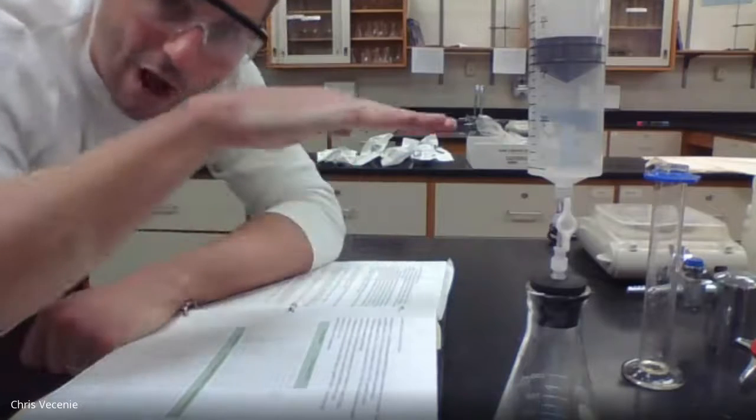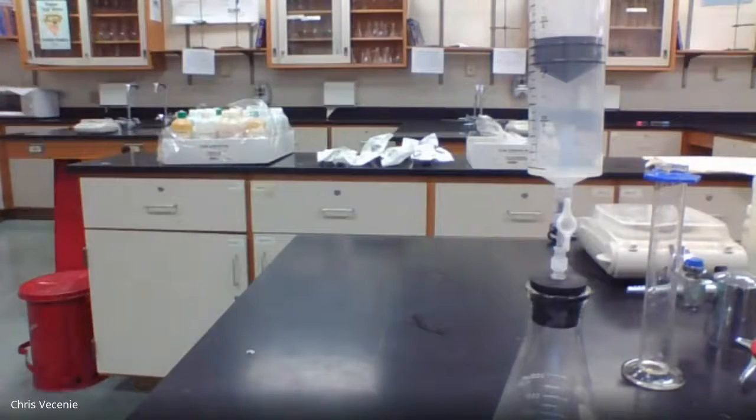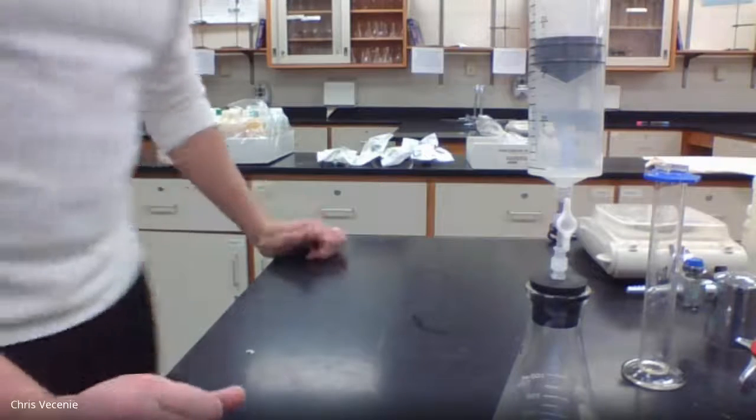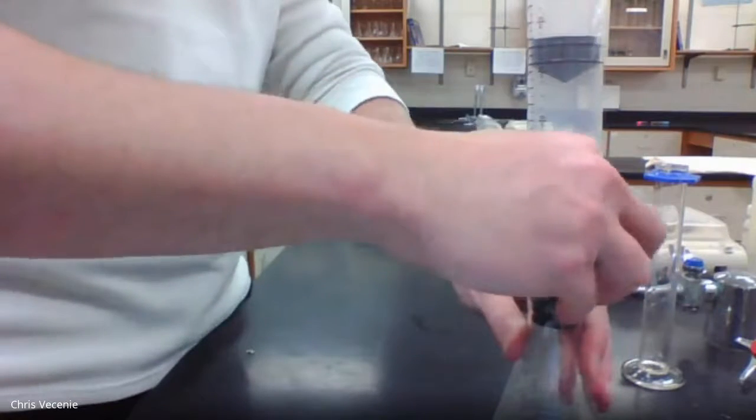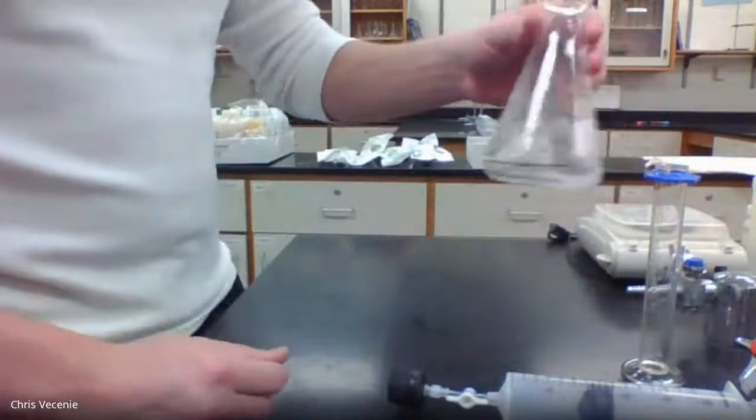What that tells us is when we get that leveling off effect, we know the reaction has ceased. We aren't creating any more gas, so we aren't increasing the volume inside of our cylinder. When you stop creating new gas, that means the rate of the reaction is 0 because the reaction is over. So that's what's going on in part 1. And like I said, I'll toss those into that table for you. But just in case something glitches, I wanted you to have those numbers in the video as well.